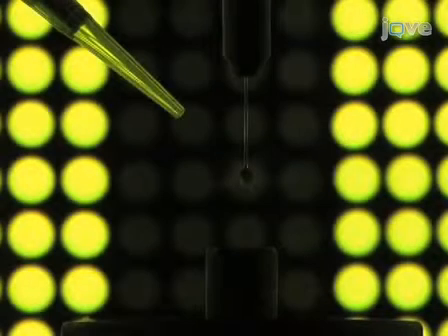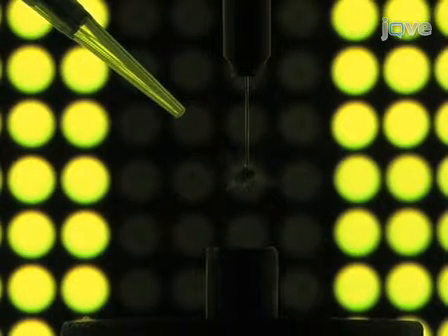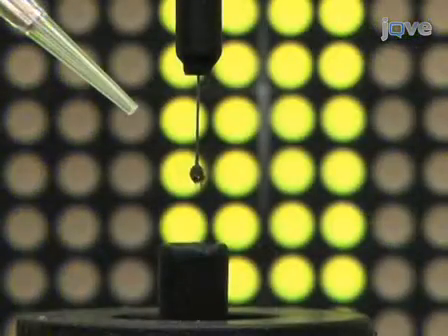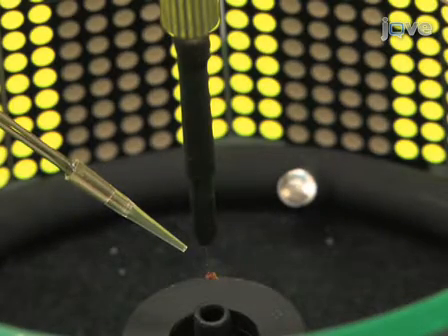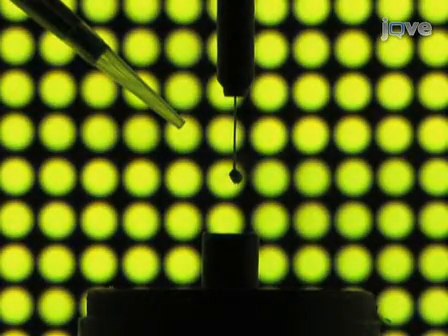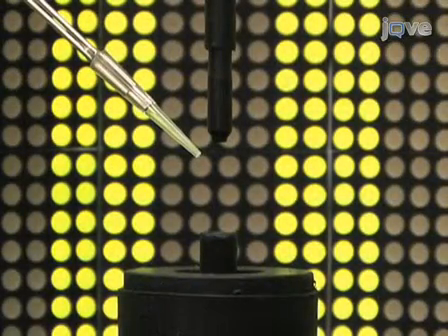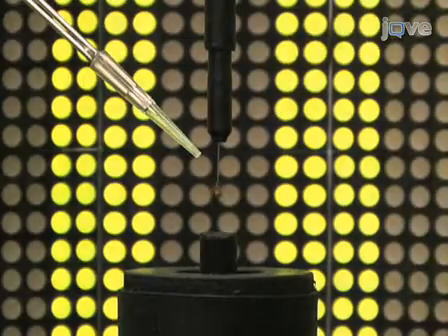One simple experiment in the OMT is to observe a starved fly locating and actively tracking a plume of attractive food odor. These experiments are typically run in a random block format to minimize any bias in experimental order. By manipulating the visual surroundings, you can influence the fly's ability to track an odor. To do this experiment, place a freshly tethered fly in the arena using a pair of forceps.